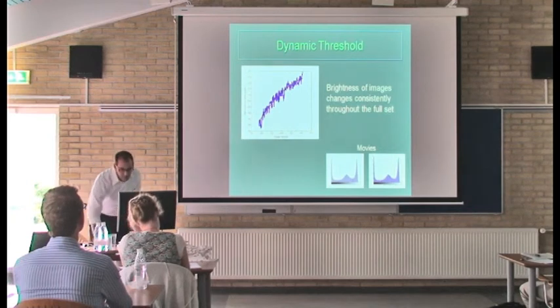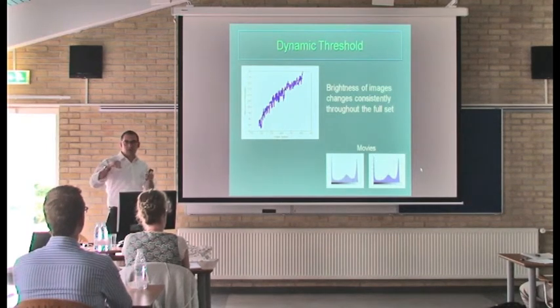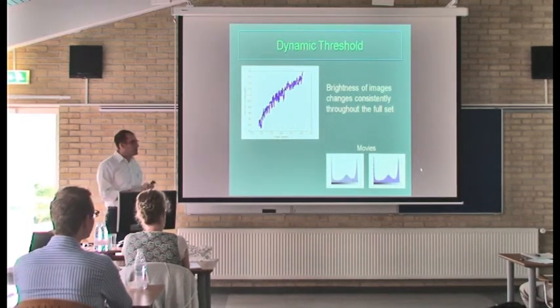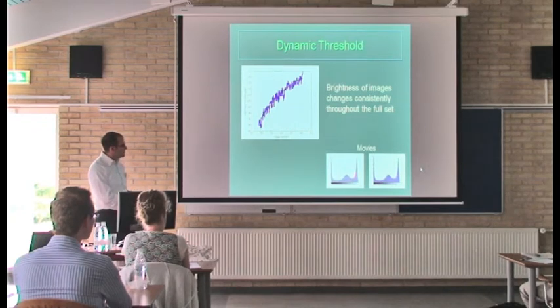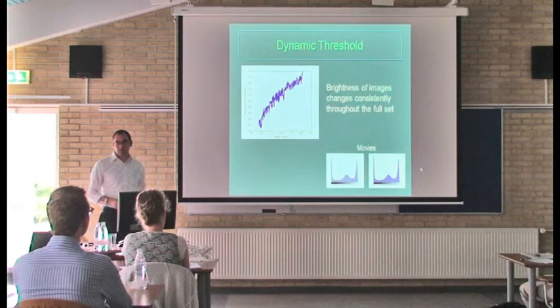And I tested these before. These are just little movies. I don't think they're going to work. But basically it's a movie of the histogram of each image as you move through the set. And basically what happens is the brightness overall increases. So both of these peaks shift over by about 40 to 50 grayscale values, which if you're thresholding at a fixed value, basically you can't.